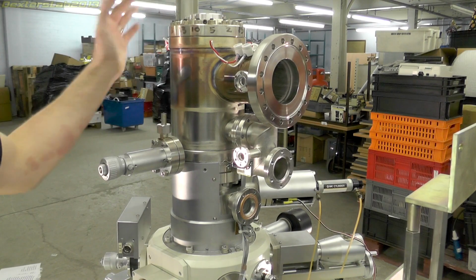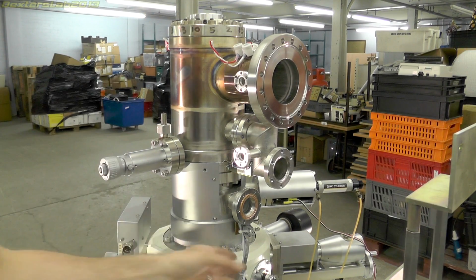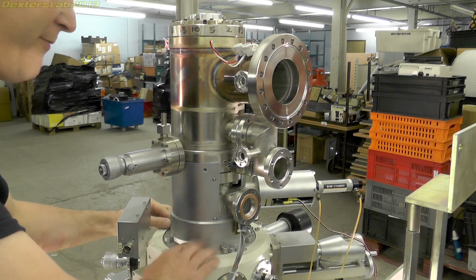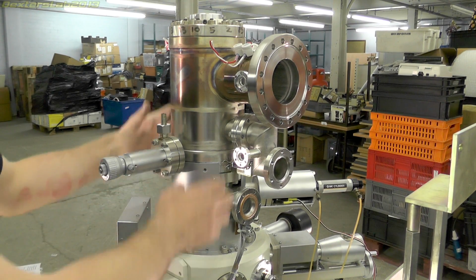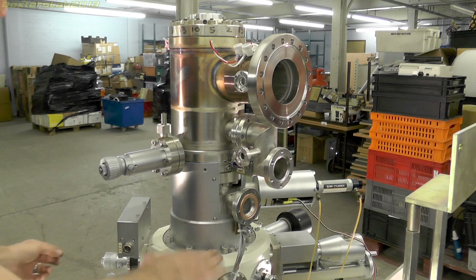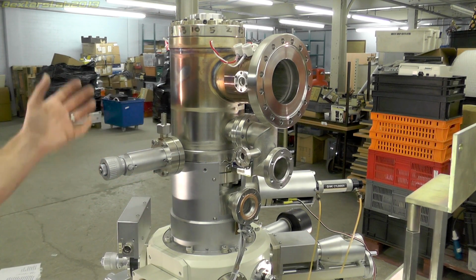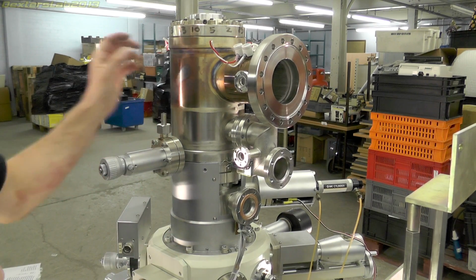Okay, I think I've managed to remove all of the devices and bits attached to the main column. There's a number of very large Allen bolts that seem to bolt the whole assembly onto the sample chamber. So I'm just going to remove those now, and then hopefully I can lift this off.